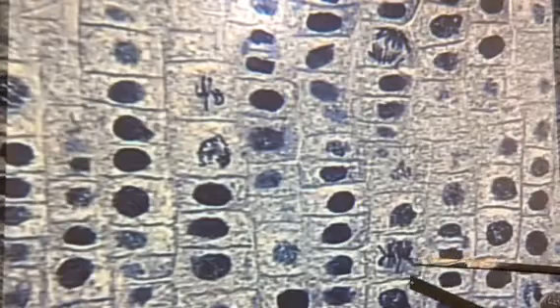And always think meta in the middle. So now we're looking for chromosomes that are lined up in the middle. They're getting ready to split. I think I see two on here that I would classify as metaphase. Remember, this isn't perfect. These are living cells, or once living cells, so it's not going to be like a perfect animation. So I like this one right here for metaphase. You can see like the 50-yard line right here, and the chromosomes are going to be pulled apart here momentarily.